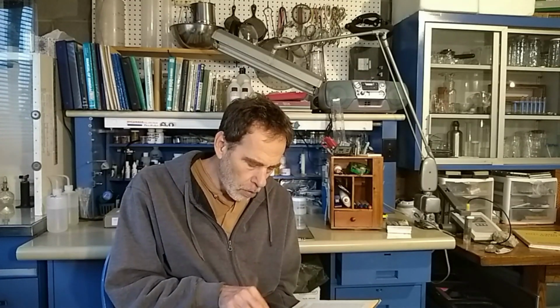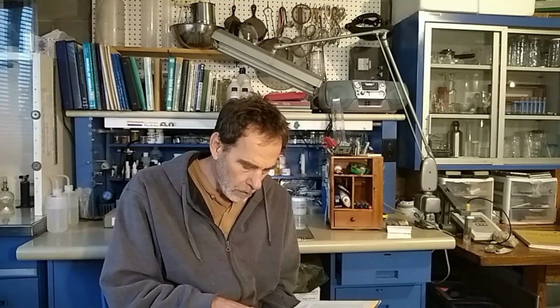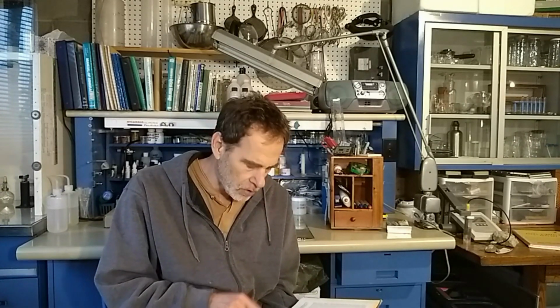And there are 3 tests. One, you put a drop of ammonium carbonate. With the other one, you add an ammonium sulfide solution. And the last one, you add a potassium iodide solution. And I'm going to try to take a photo of this chart here of those 3 items and the different metals associated. And the different metals will have different reactions.